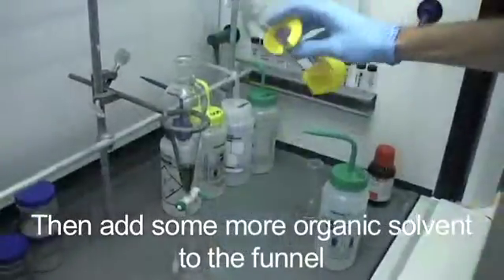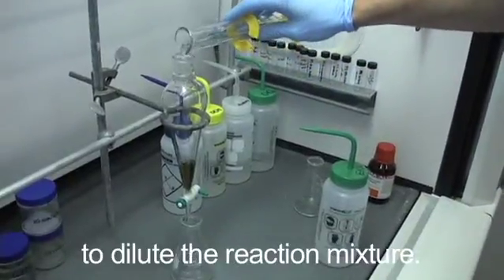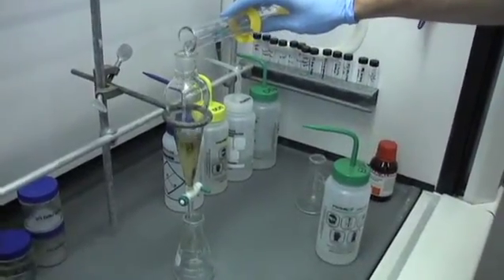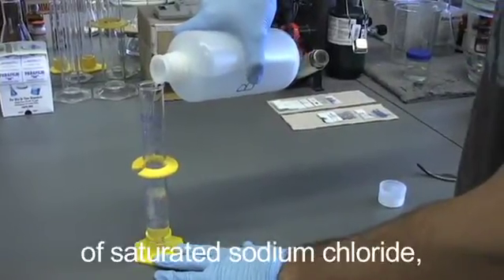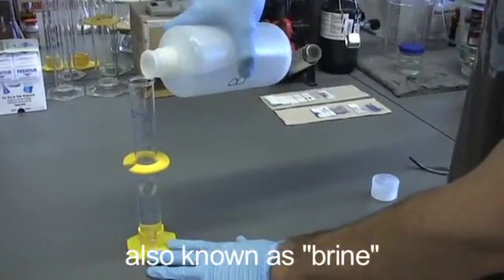Then add some more organic solvent to the funnel, to dilute the reaction mixture. I then add about 50 milliliters of saturated sodium chloride, also known as brine.